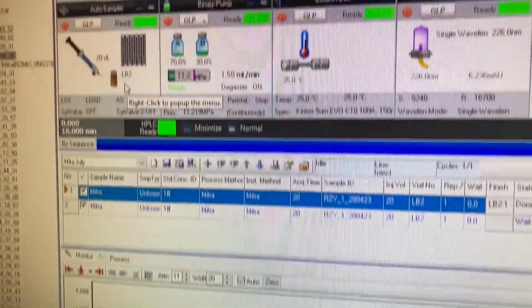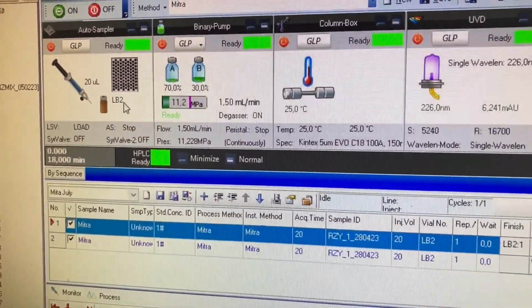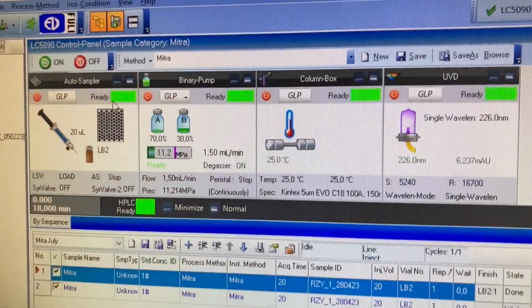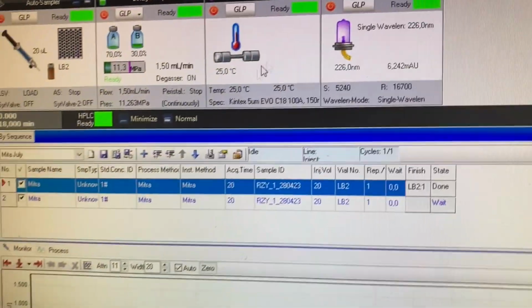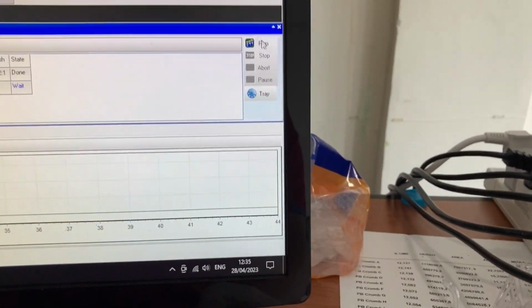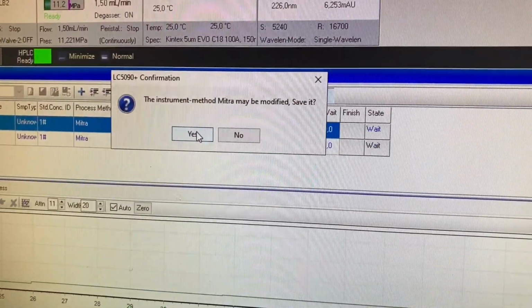So she's all ready to go, vial's in the correct place. Everything's good. It's all ready. It's all green. It's all up to that ferrule there. Right, let's give it a shot.